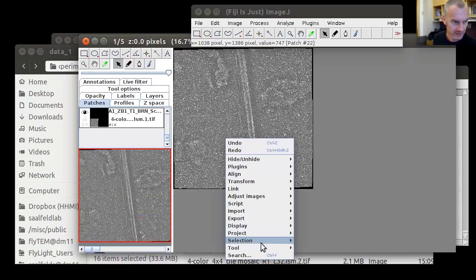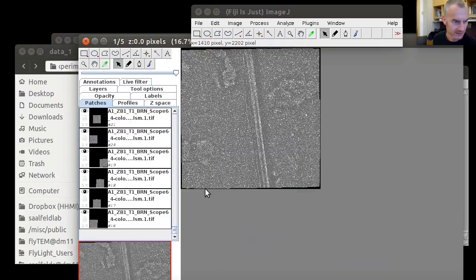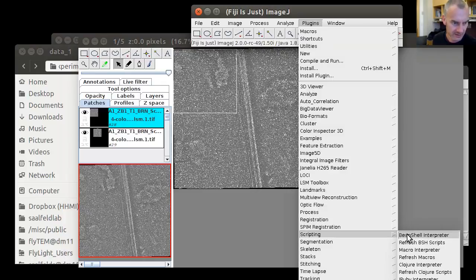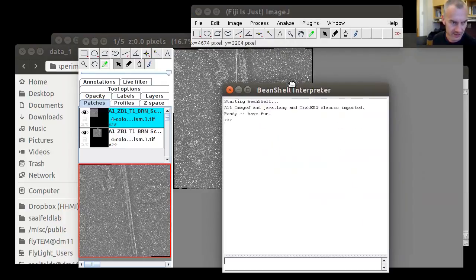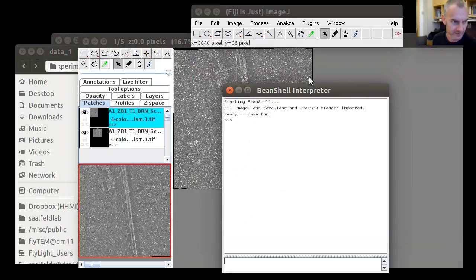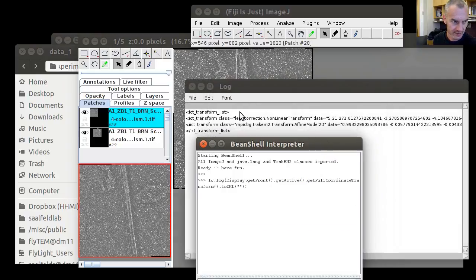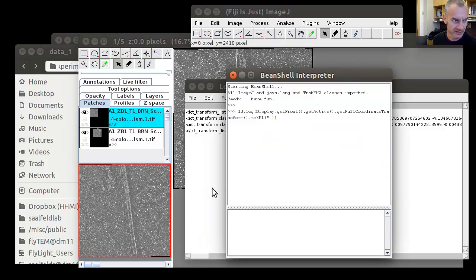So now, how do we get a hand on these transformations? We can just select the first tile and use Fiji's scripting interpreter. BeanShell is a good language for these kinds of things. We close the log window to make it clear for what's coming up now. And now we can log the transformation, the complete transformation of the first tile that we selected in the current field of view. That's the XML export. We see that this transformation consists of the nonlinear part and the affine transform that brings them all on top of each other.